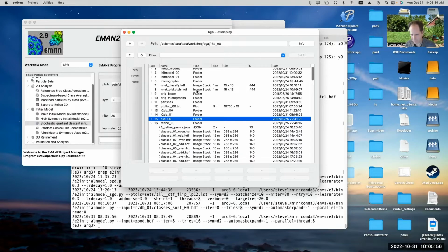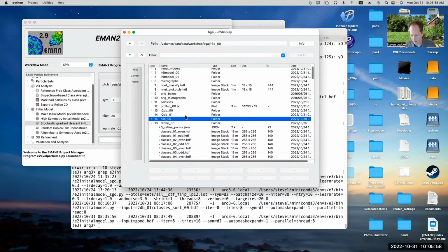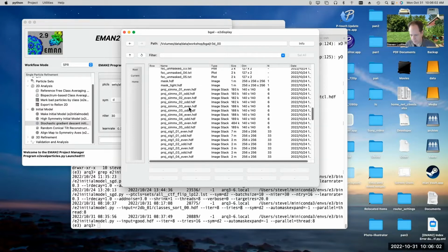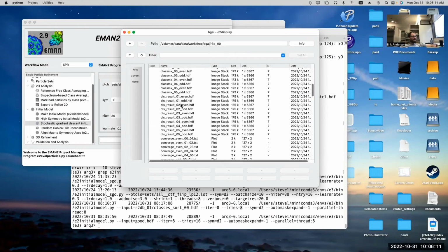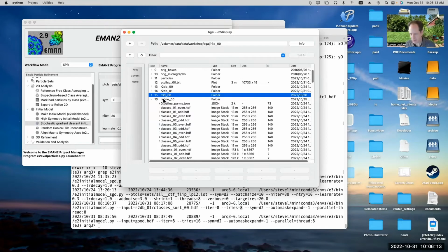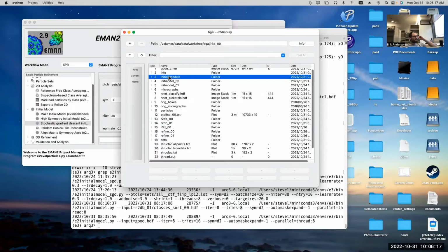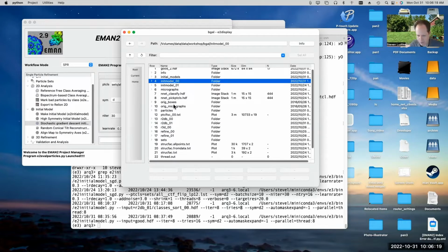So if we look at the first refinement, we can see a bunch of files in the folder. Real quick, could you explain the significance of how you came up with the names, like R2, like refine 3D? You want to know the names of the folders? I guess that's in the refine 2D. Is that where the names of the folders come from? I think the init model and initial models, that's pretty straightforward.